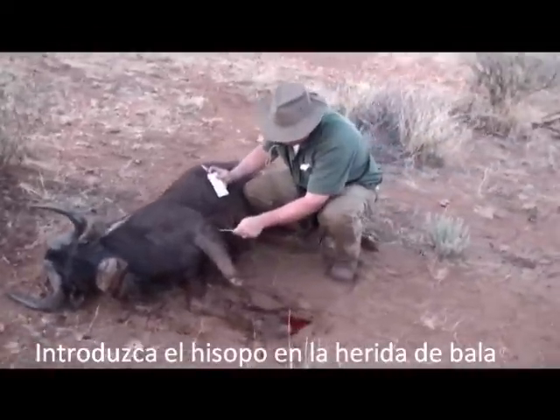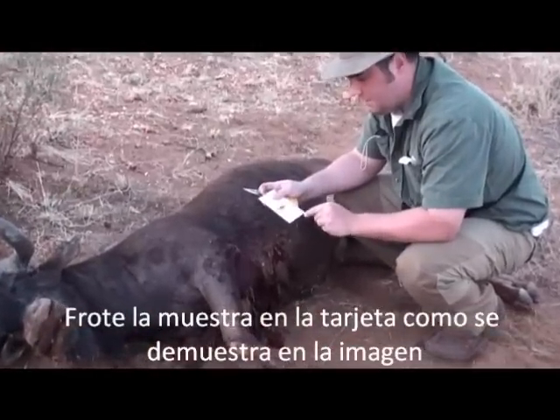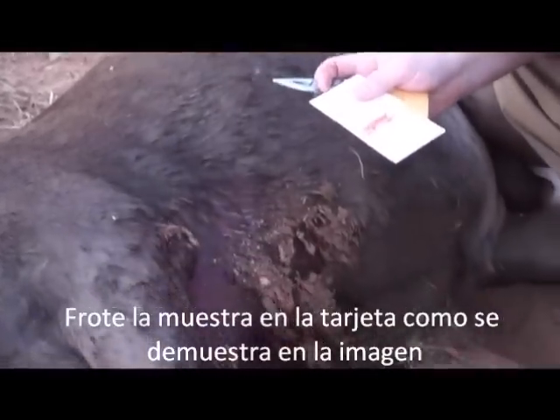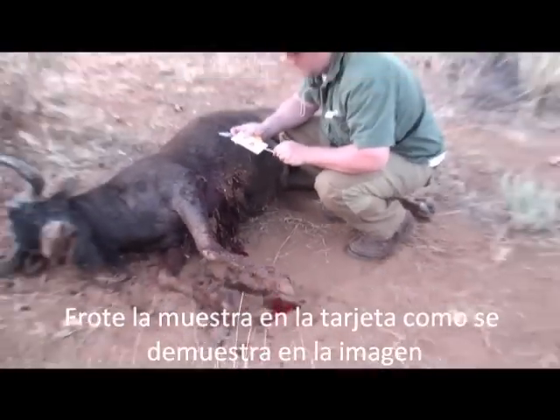I'm just trying to get in here with the bullet hole. Get that card — got a lot of blood — just smear it on, just paint it on. We got some blood right down here, we can just dip right into that. That works too.